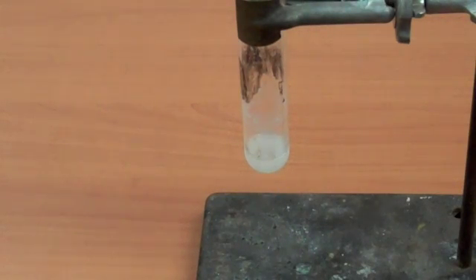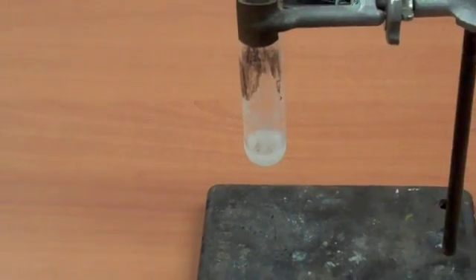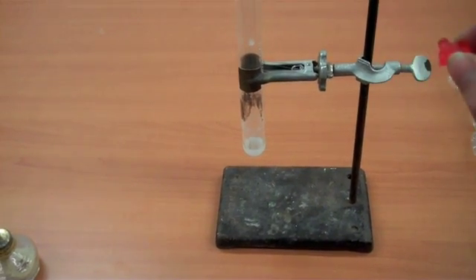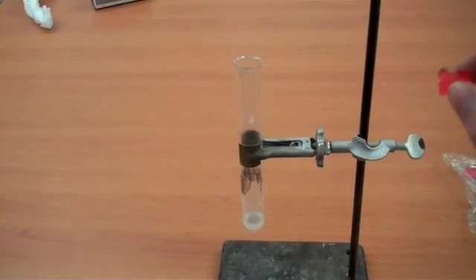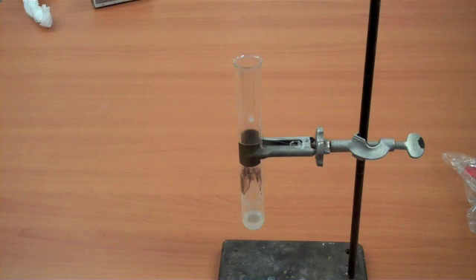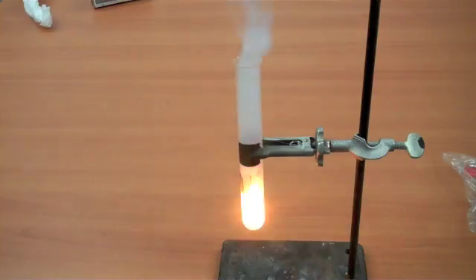And what we should see is that oxygen attacks the sugars in this gummy bear really quickly, creating a release of heat, so much so that the sodium chlorate continues to decompose and continues to produce an exothermic reaction.